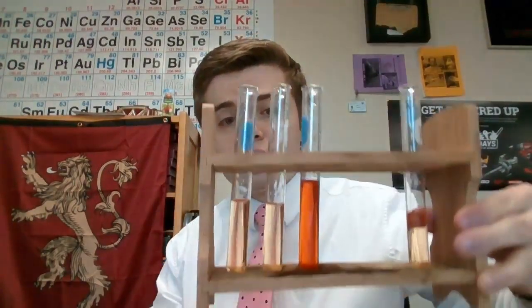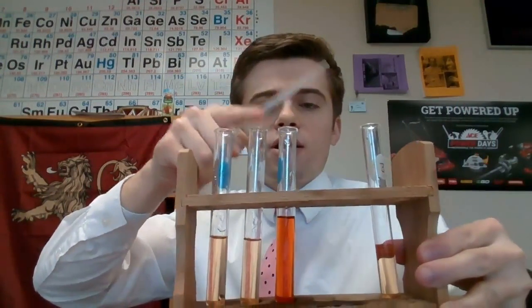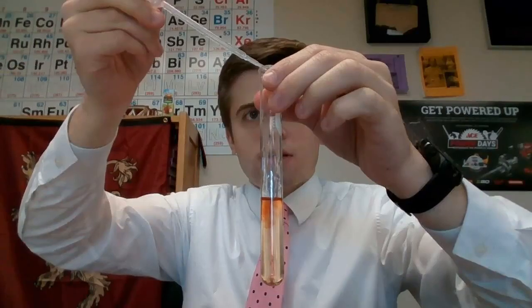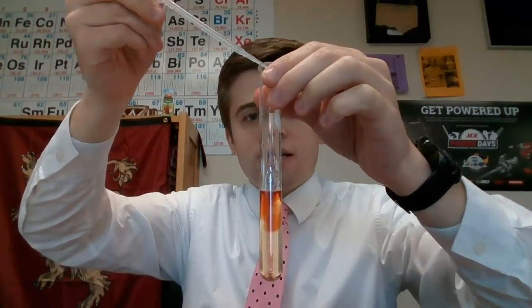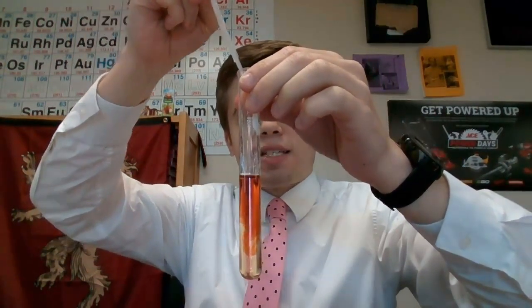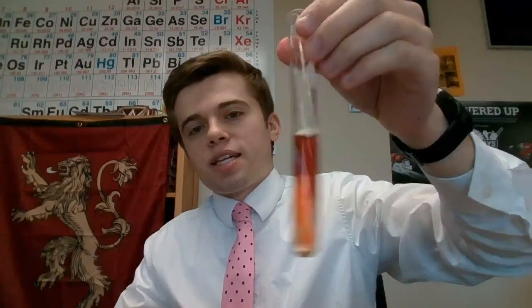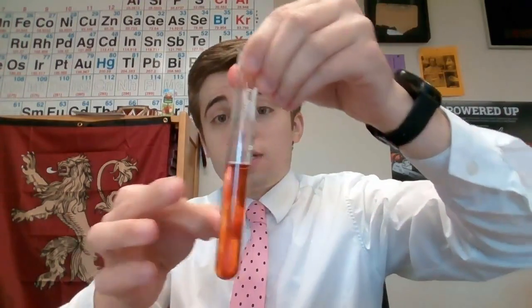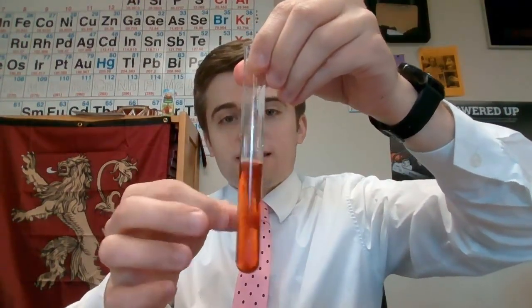So next, to test tube number 2, we're going to add the potassium thiocyanate, I believe that's how you pronounce it, which is KSCN. I'm going to put it in this pipette here, and I'm going to hold this up so you can see, and we're going to add 20 drops of this to our solution. 5, 6, 7, 8, 9, 10, 11. Maybe we'll do a little bit more than 20, because why not? This is chemistry. We're supposed to be a little crazy, have some fun. And we're going to make sure that's mixed up as well as we can get it while it's inside of this test tube.